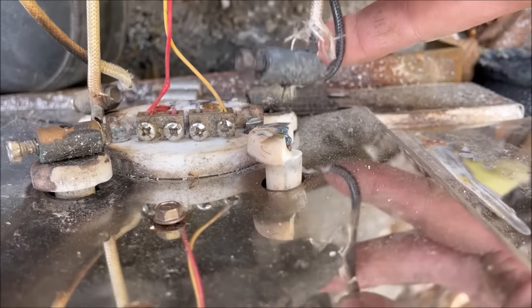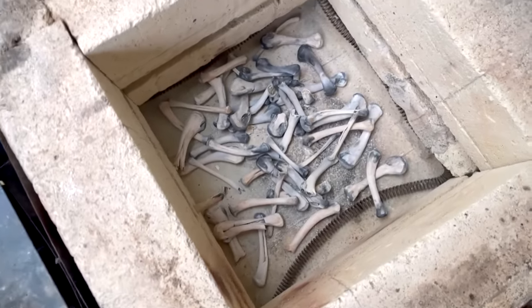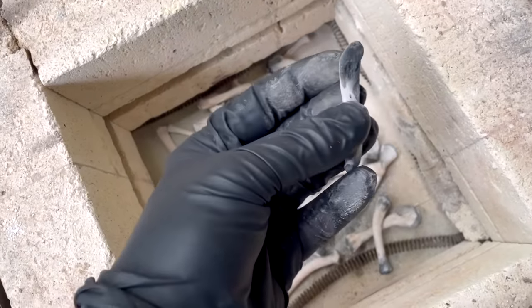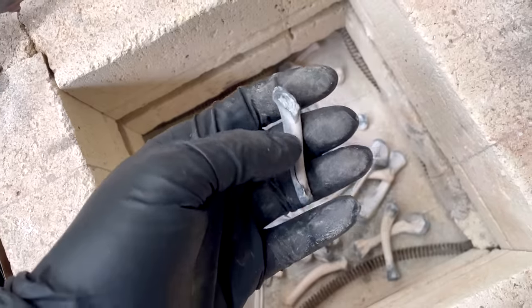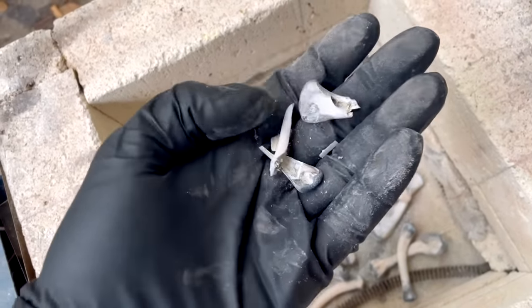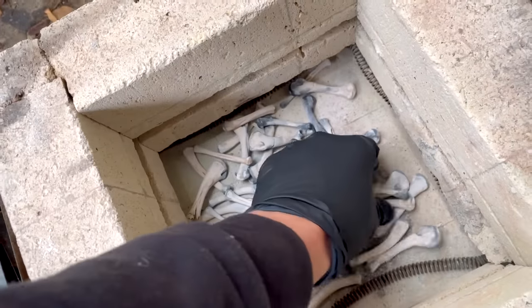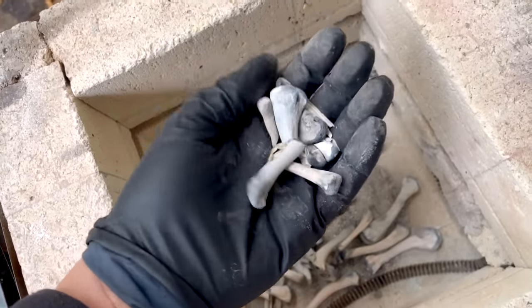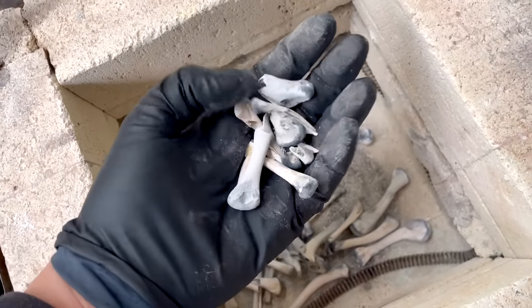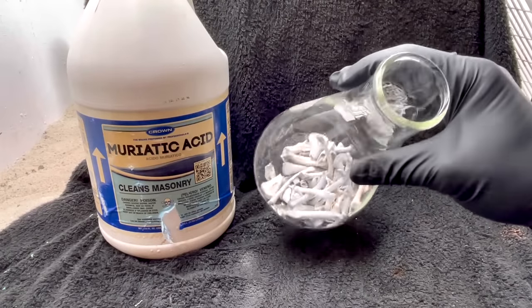It's the next day. The furnace actually quit, but it did get pretty hot and we did burn the bones mostly. You can see there's still a little bit of carbon left on them, but at this point it's going to be in the form of a char, so it really shouldn't cause too much trouble. The bones are considerably more fragile now — they've lost the binding properties of the collagen. Essentially we have bone ash, which is calcium phosphate with some minor impurities.